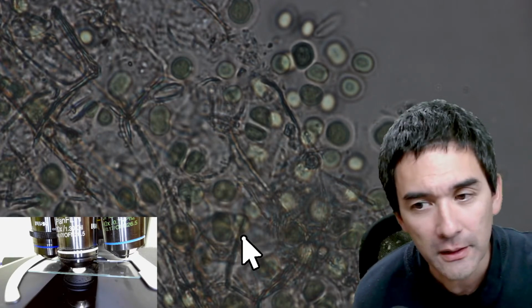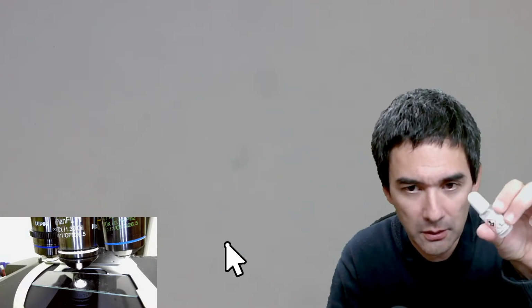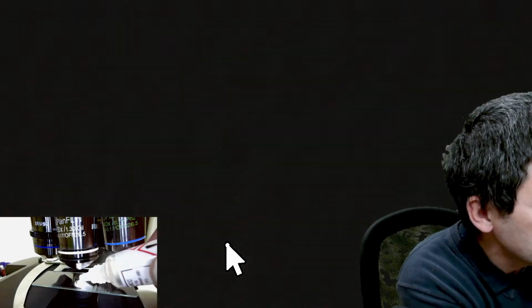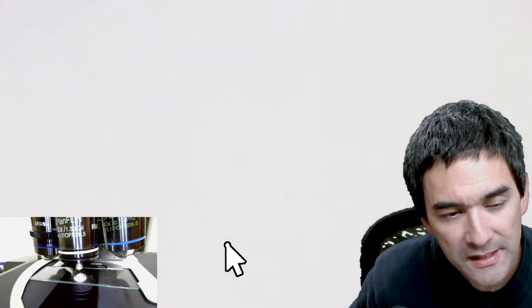So what I'll do is the following. So let's lower it. You can of course see here in the corner what I'm doing. Here is the bottle with immersion oil, and I'm going to now apply a drop of immersion oil directly on the cover glass. Okay, and then I change the focus again. I raise it again until it goes in here.